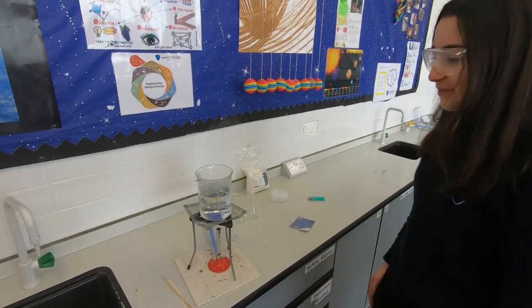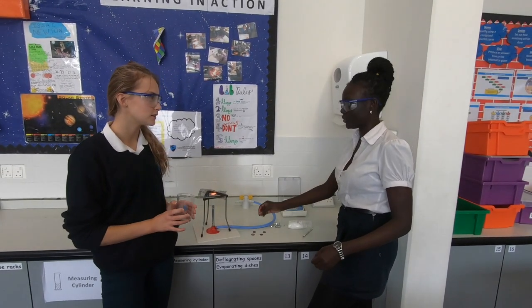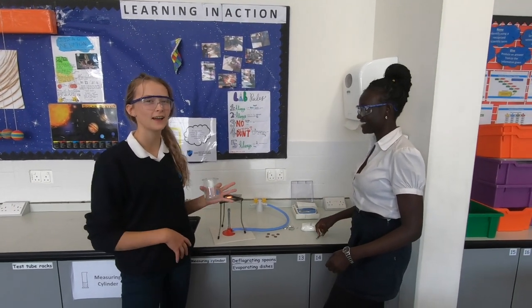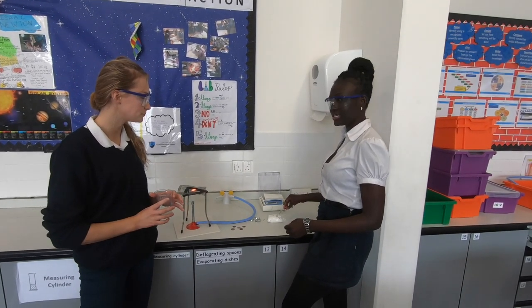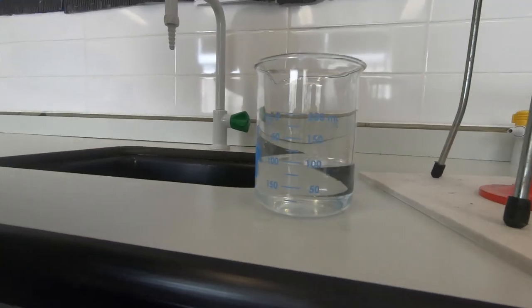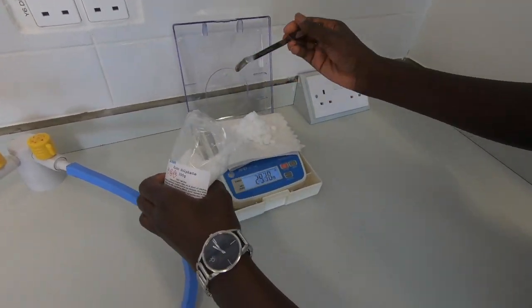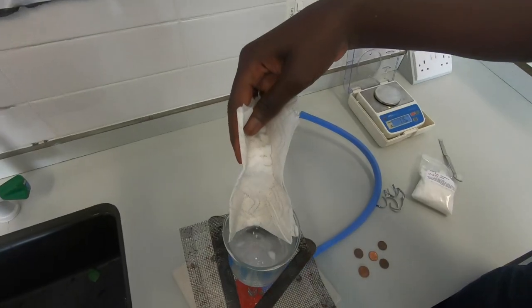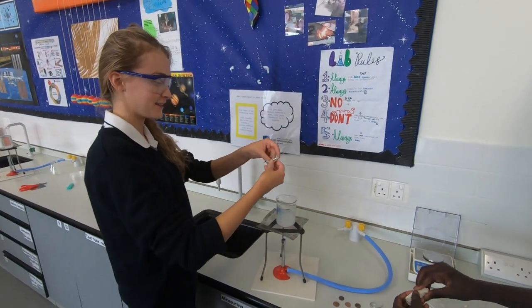We're going to be turning these copper coins into silver and then gold. We're going to need first 30 grams of zinc sulfate and then 100 ml of water. We put it on the Bunsen burner. We must add the zinc sulfate into the water, and then we're going to add the zinc strips to the mixture.